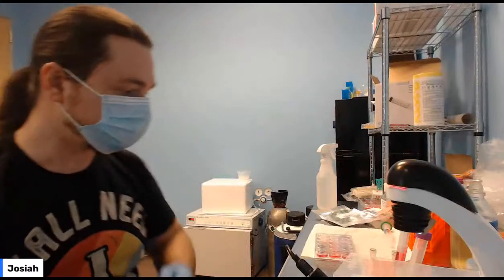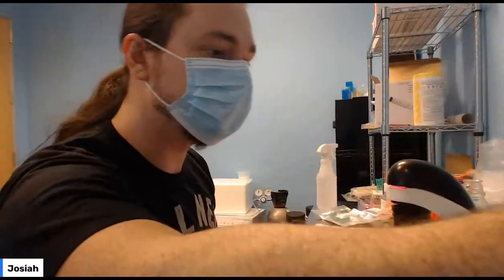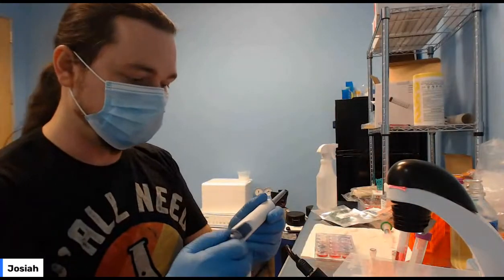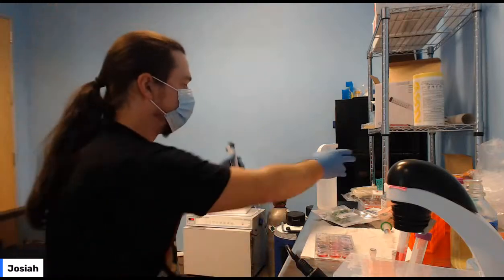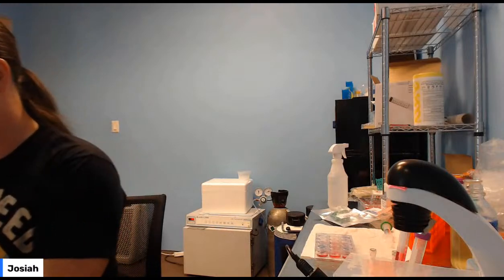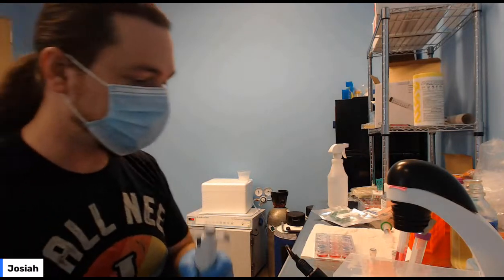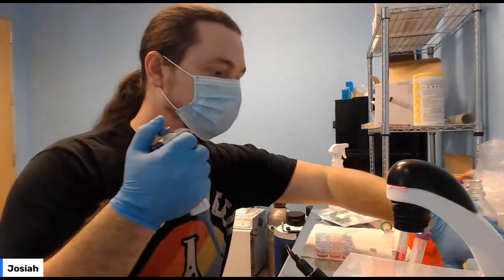Okay, so you're going to take 50 microliters. You're going to need to switch pipettes to the middle-sized one. 50 microliters of your filtered media. You want to use clean media because we're building a reaction that's going to go in the wells. Remember, this is a couple of days later, and your wells are at 70%. Everything looks good.